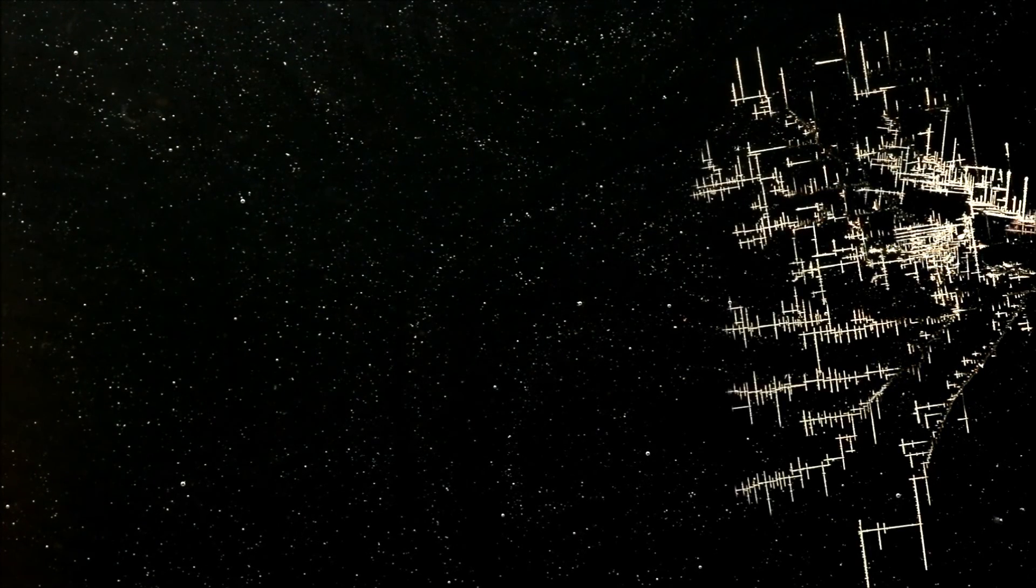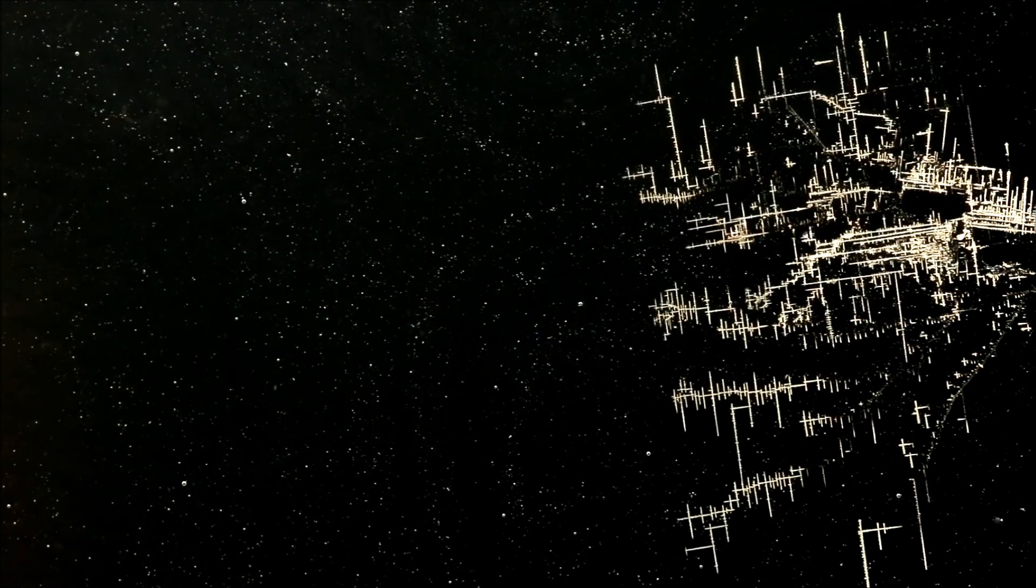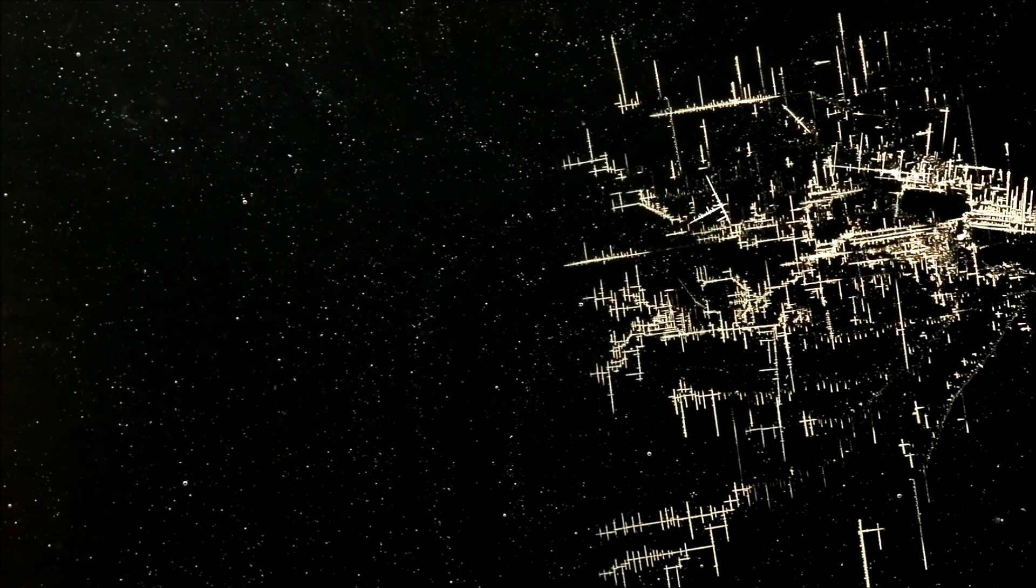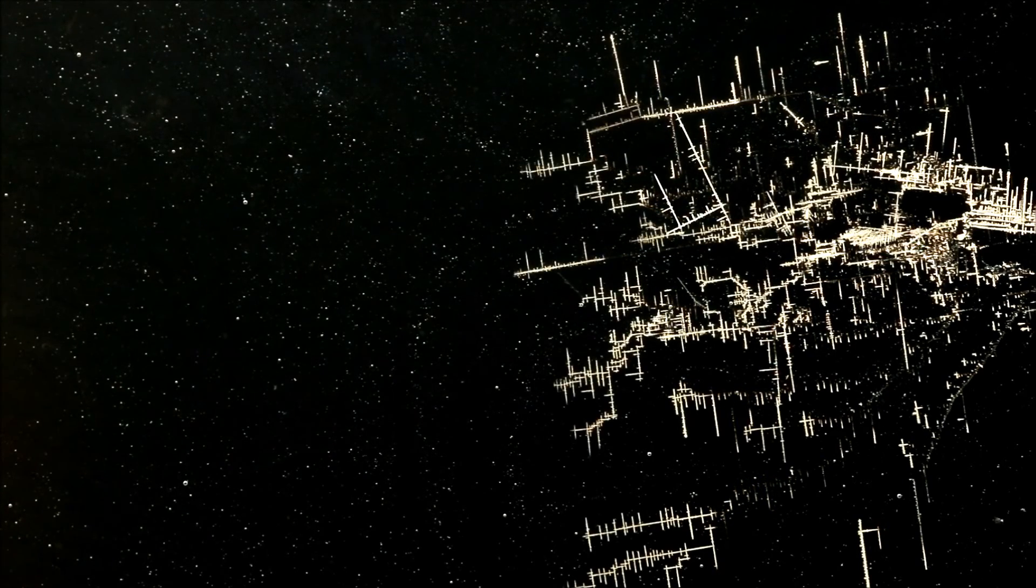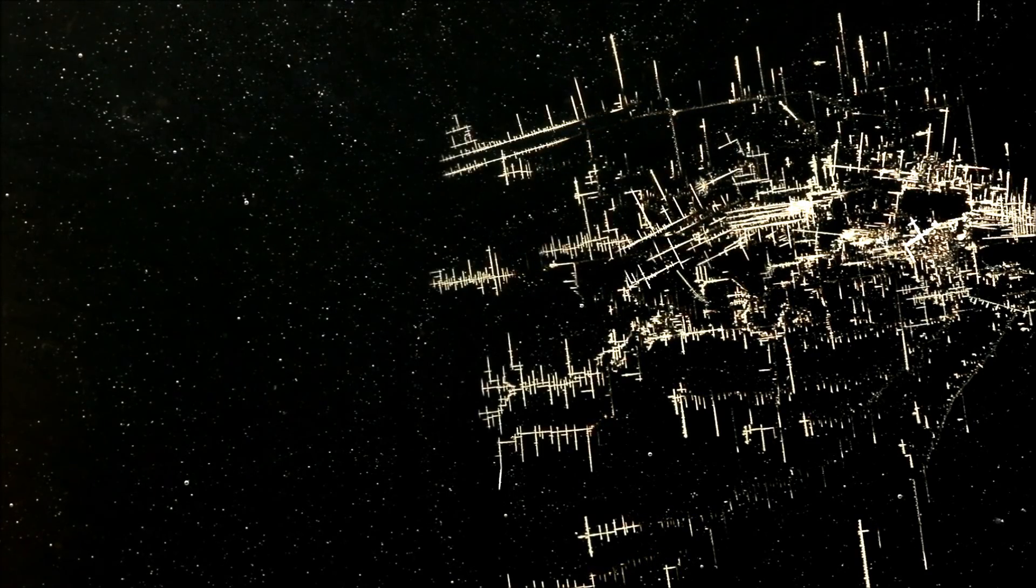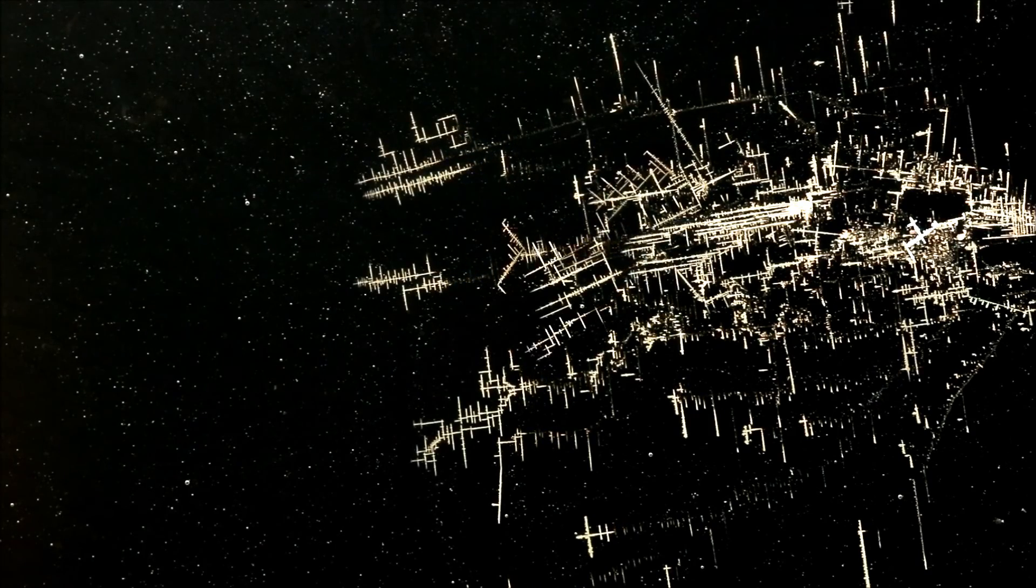In this segment, the electrode supplying the electrons to create the tin metal is on the right. Here you can see something very unique about using electricity to grow crystals. You'll see some spear-like pieces of crystals break away from the main body and appear to travel by themselves from right to left.